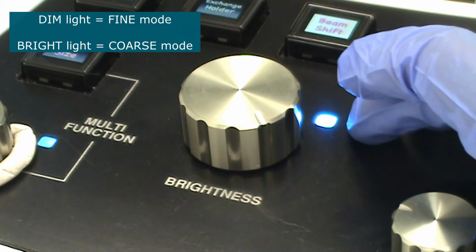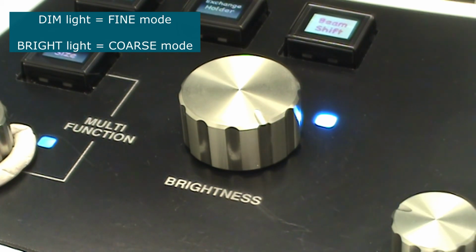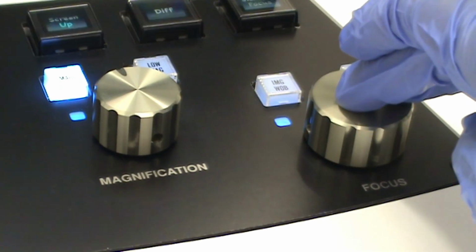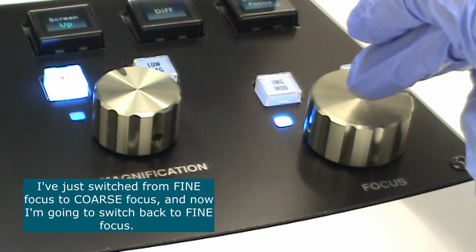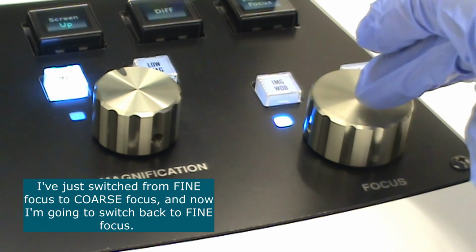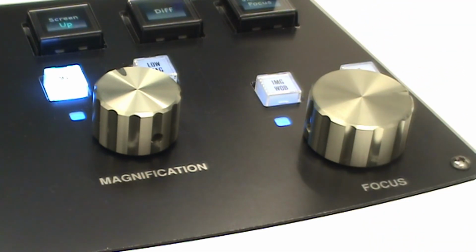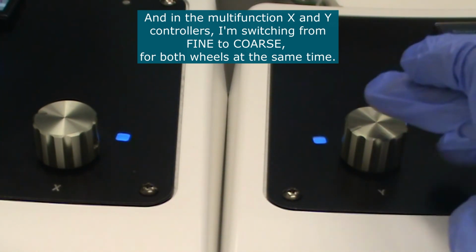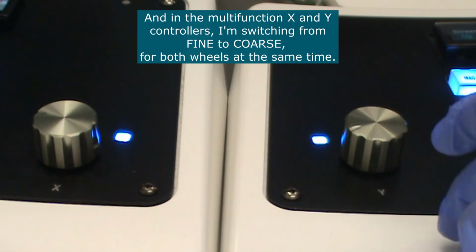So it's on coarse when the light's bright, and it's on fine when the light's dim. This is also valid for the focus wheel. So I switched from fine focus to coarse focus, and now I'm going to switch back to fine focus. And in the X and Y multifunction controllers, I'm switching from fine to coarse for both of them.